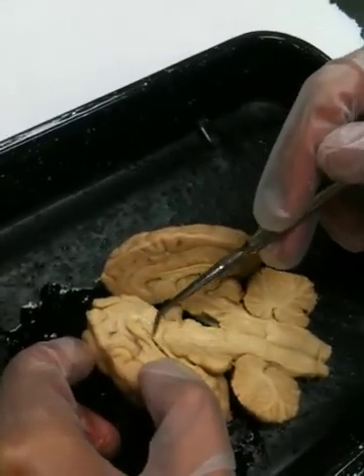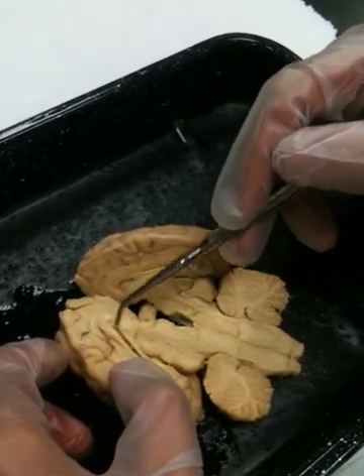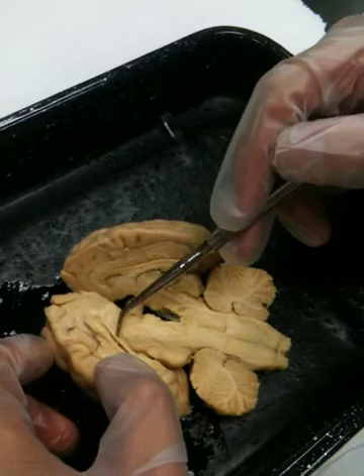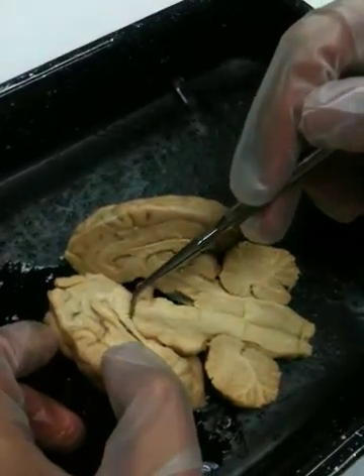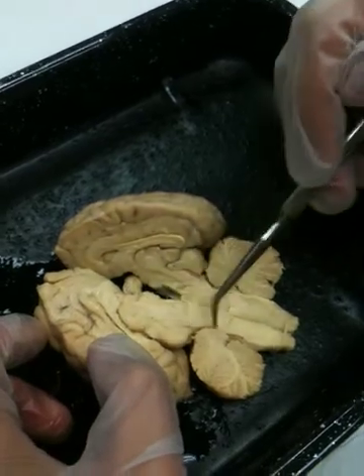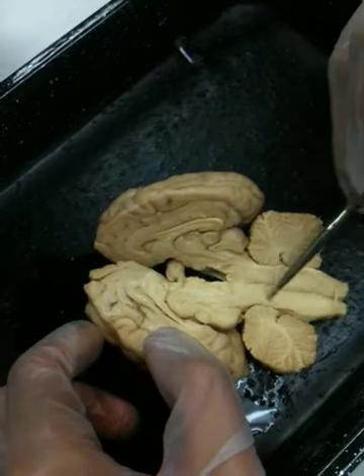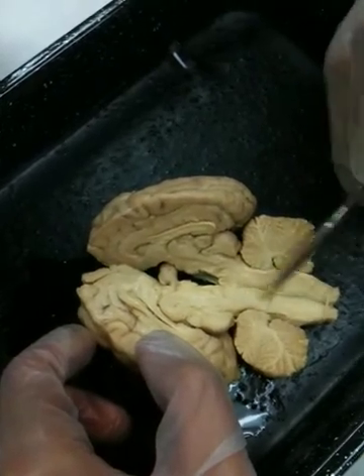It runs out of the third ventricle, behind this large lump right here. Corpus callosum, lateral ventricle, fornix, and then third ventricle. It comes straight down through here, and this passageway, until the fourth ventricle, the entire passageway is called the aqueductus sylvius, or the cerebral aqueduct. Not on your lab. It connects the third and fourth ventricle.